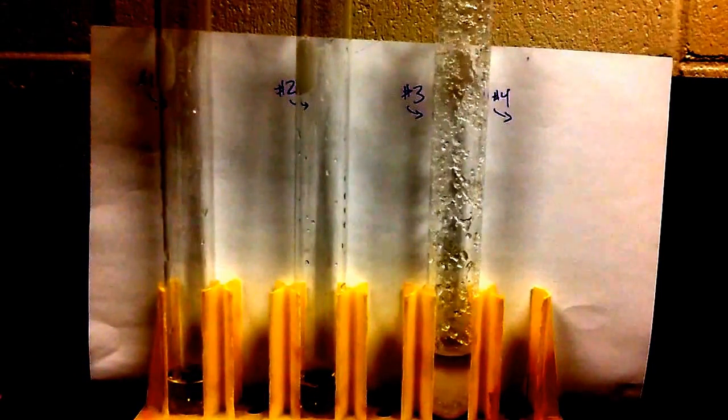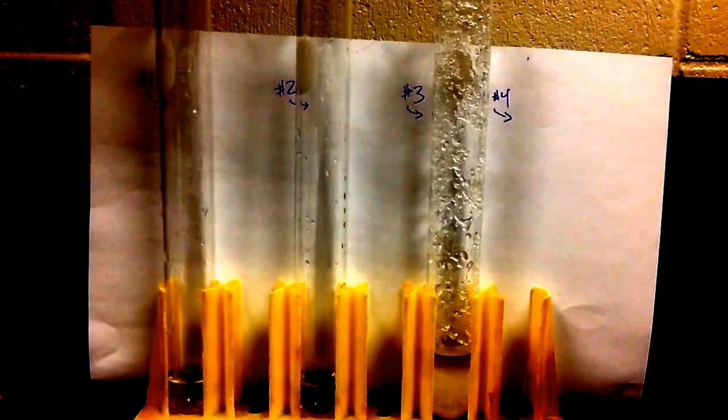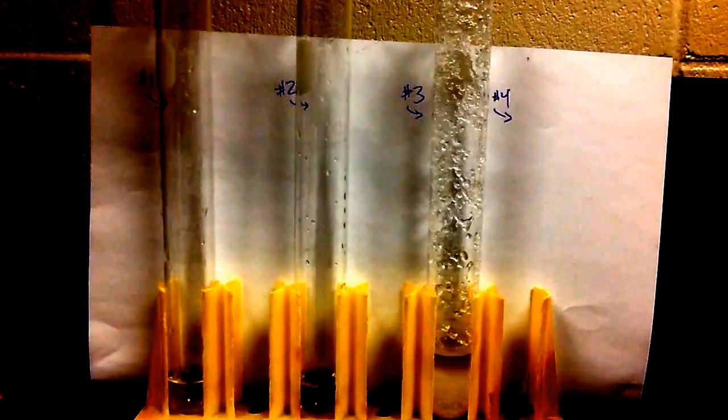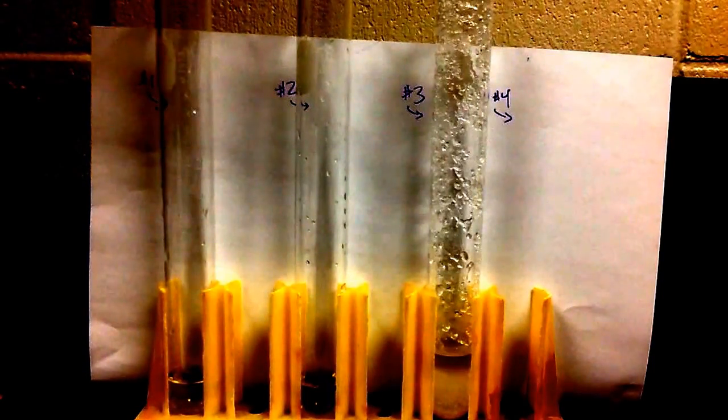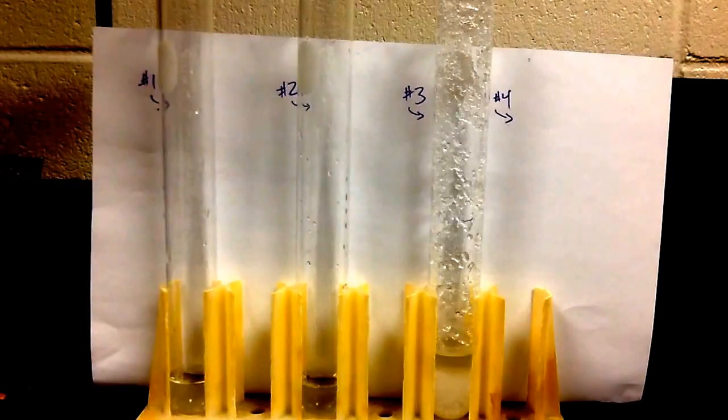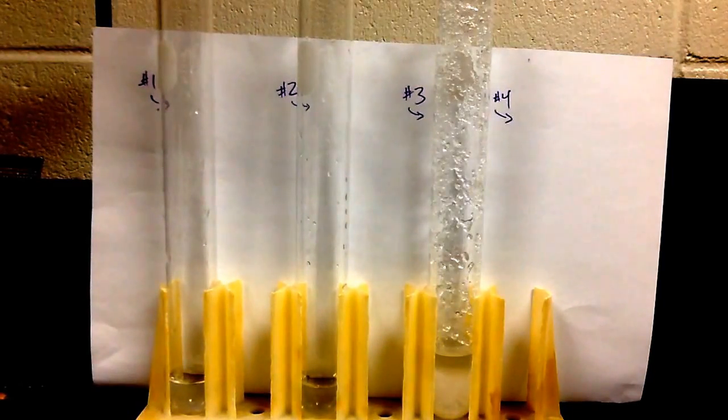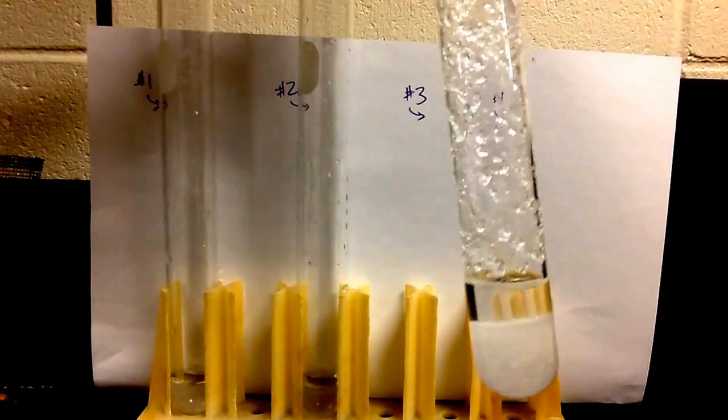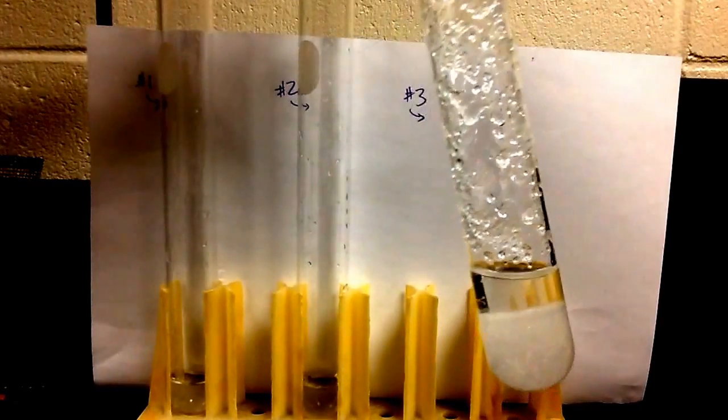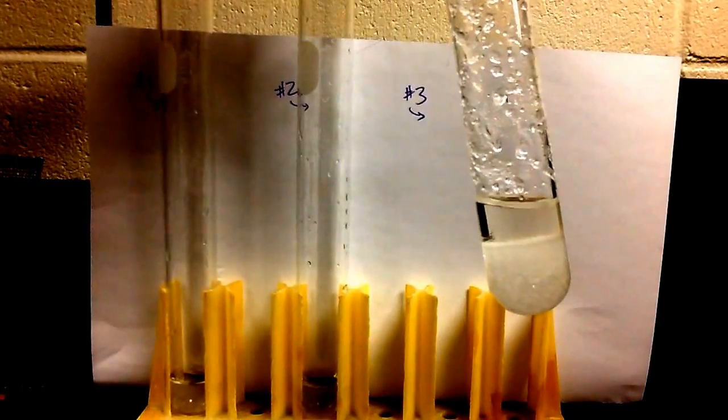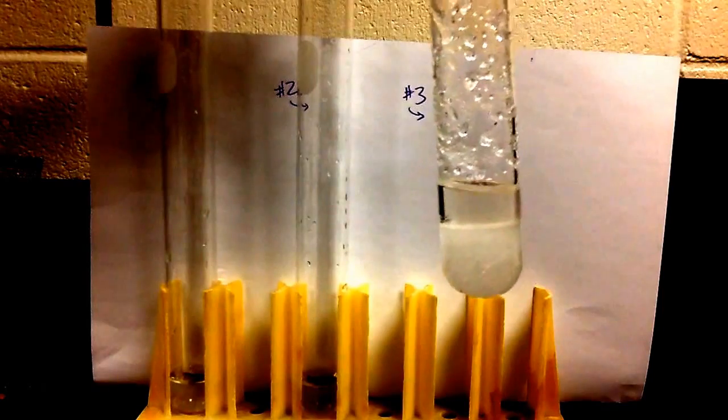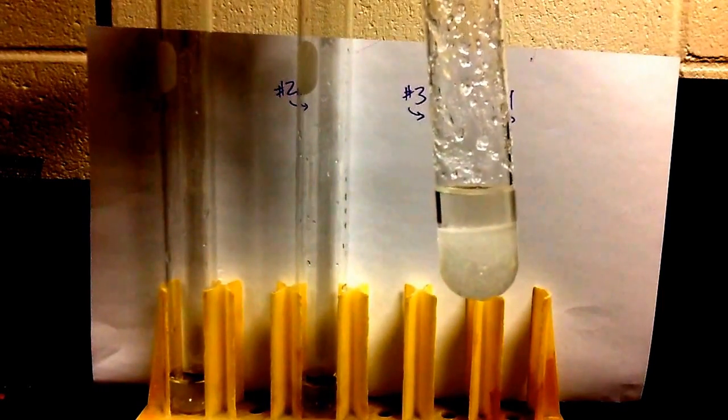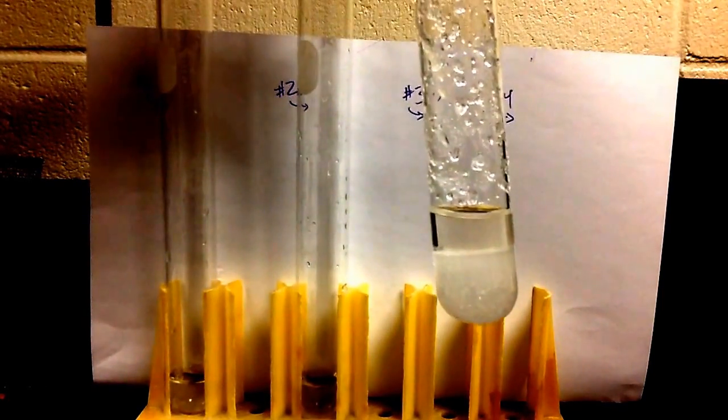So then we said, okay, we've added 0.5 grams, and then another 0.5 grams, and then we added 14 grams. We shook that up, we shook it for three minutes, and we can tell from the test tube that the chemical got all spread out. Then we let it settle, and what we noticed, it formed some layers.